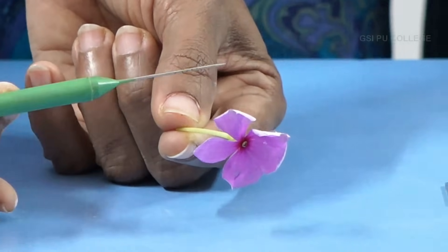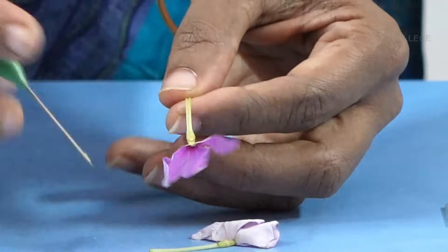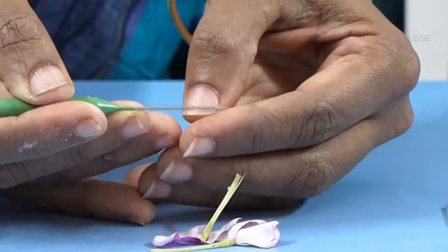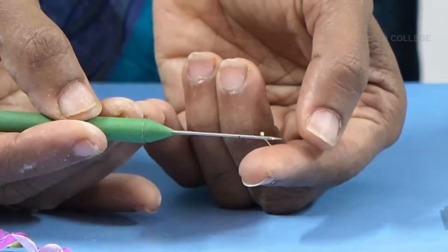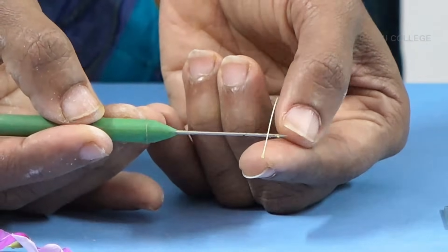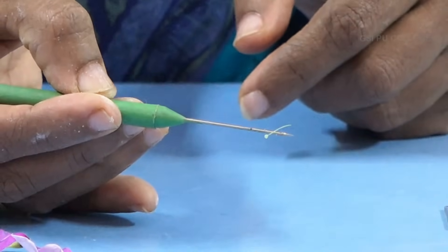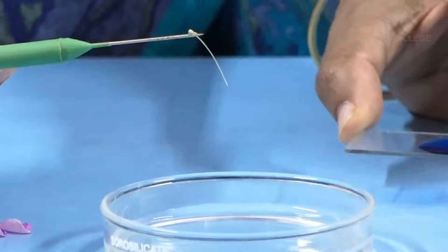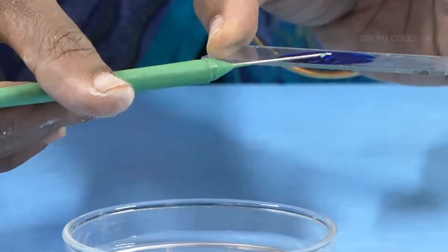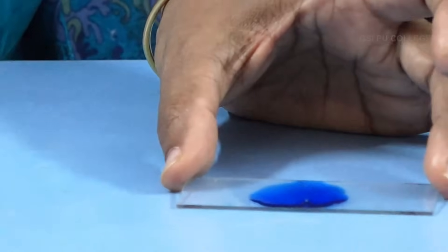You can see the ovary, style, and stigma. You have to cut in the center like this. This is the style and this is the stigmatic surface. Before doing the experiment, the style is dipped in hot water to make it very soft. In the examination you will get the style and stigma already prepared. Place it on the slide which contains cotton blue stain.